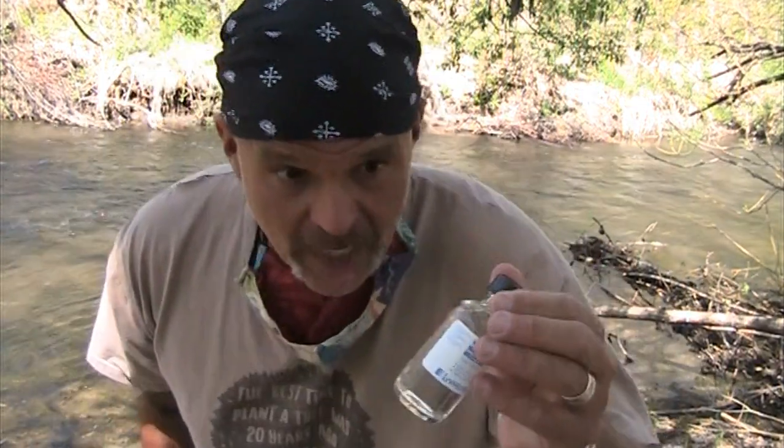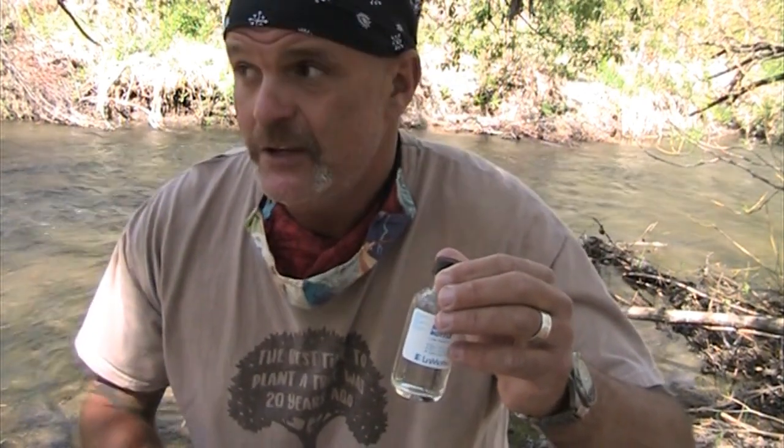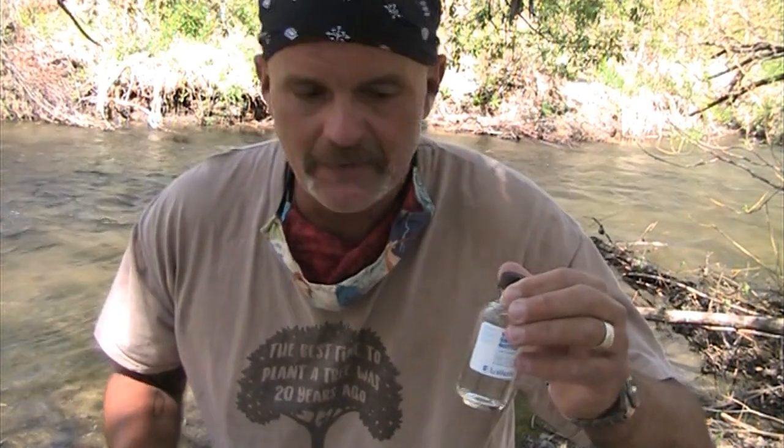Now, as soon as your sample bottle is filled, the scientist in each one of us, which makes poor choices, wants to shake the bottle. It wants to put it in its pocket. If you shake the bottle, you change the amount of dissolved oxygen. If you put it in your pocket, it warms up and dissolved oxygen goes down. So if you're doing this in the field, you want to do what's called fixing the sample right away.